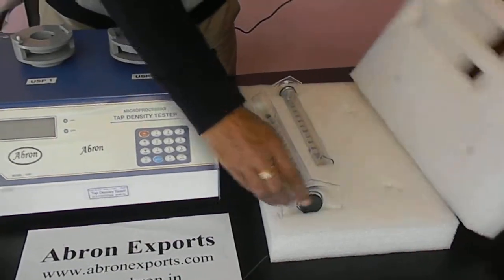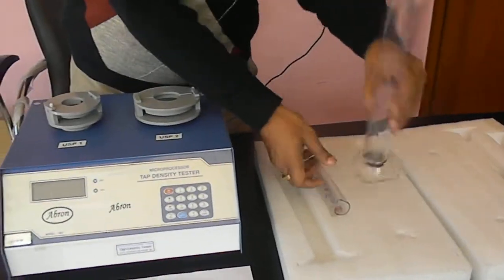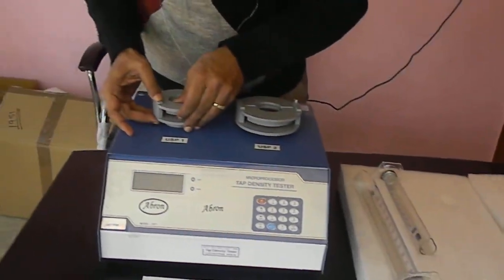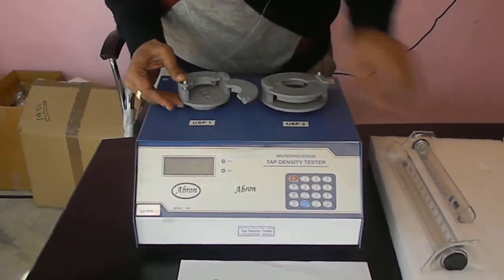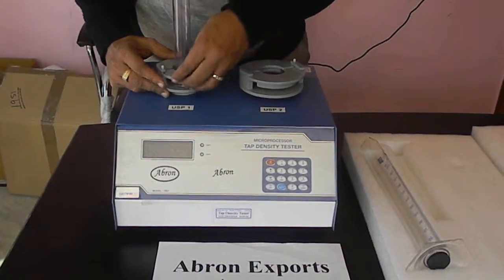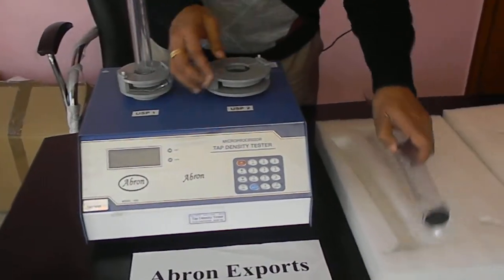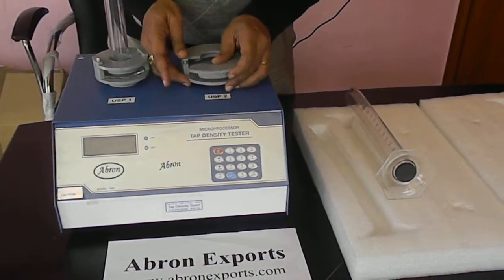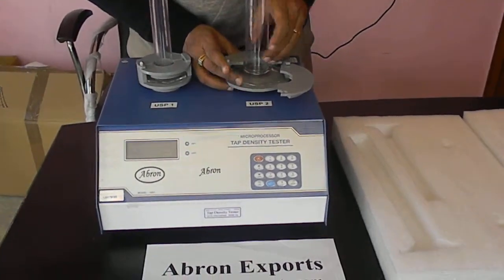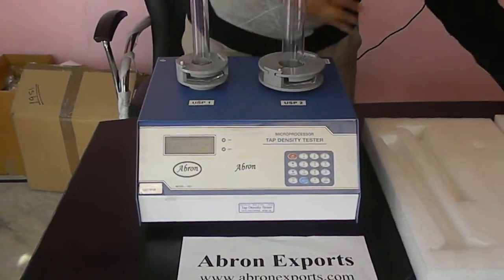There are two cylinders provided — one for bigger, another for smaller. To fit them, just press and take it out. Place the cylinder inside and close it back. It closes automatically. Similarly, for the other one, open the part, place the big cylinder in the frame and close it. This is very easy to fit.